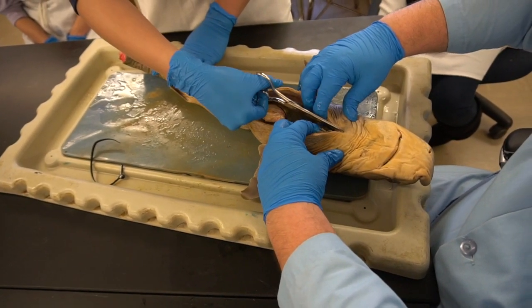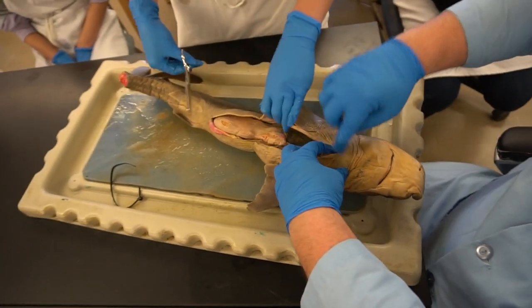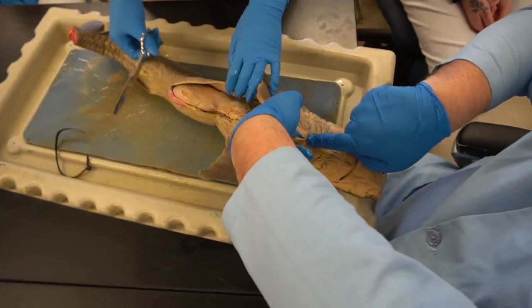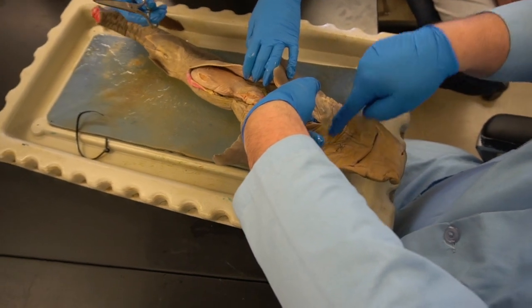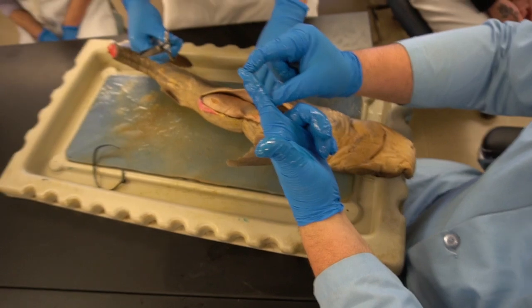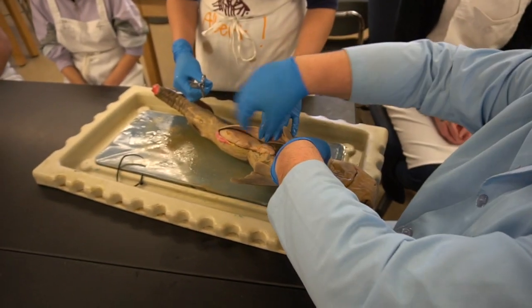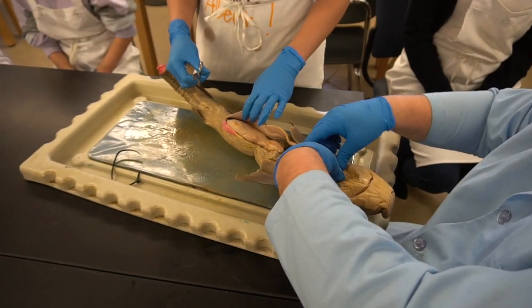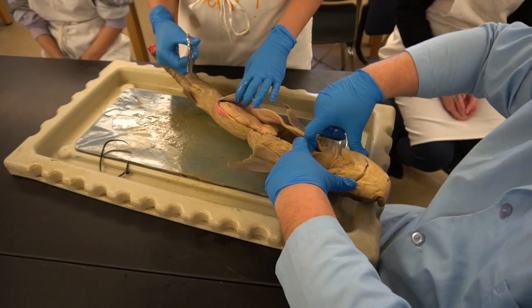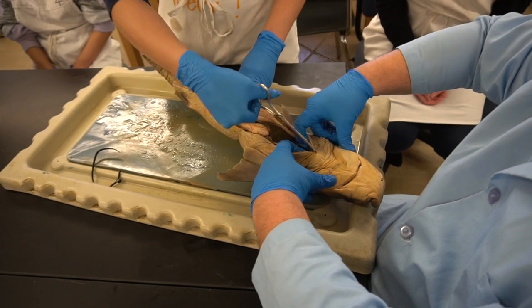Okay, we're cutting through skin and we're cutting through. All right, so now we're approximating where the cartilage is. If I stick my finger in here, I got up to about here is where the cavity ends. So I got about a fingertip, about this much room to go. That's going to reach the anterior body wall of the abdominal cavity, so we have to get through that. The best way to do this is to have your secondary person put some pressure with the tips of your fingers and push outward, so you can get through this a lot easier.